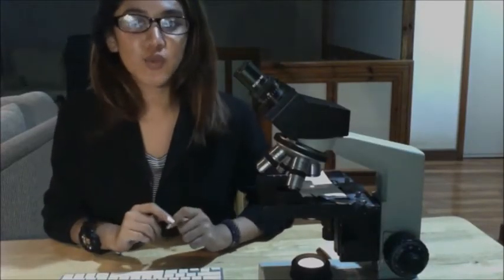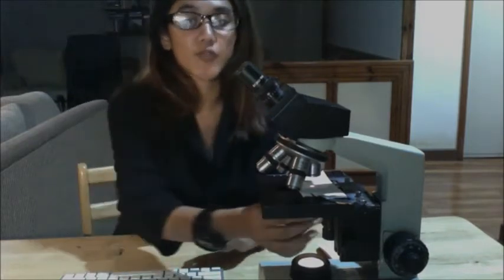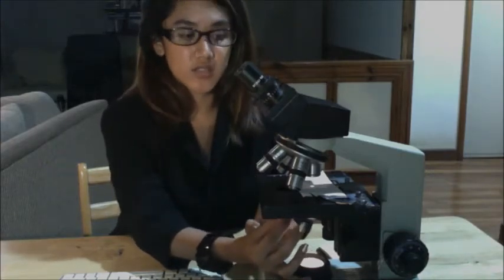So now, in preparing to adjust the light on the specimen, use the stage adjustment knob to move the stage forward, backward, or sideways to get a better view of your specimen. Now, we are going to learn how to adjust the condenser and the diaphragm to get reasonably good, consistent lighting. The next thing that you have to do is close the diaphragm as far as possible by rotating the diaphragm ring. Try to notice that the light doesn't disappear, but rather it decreases.